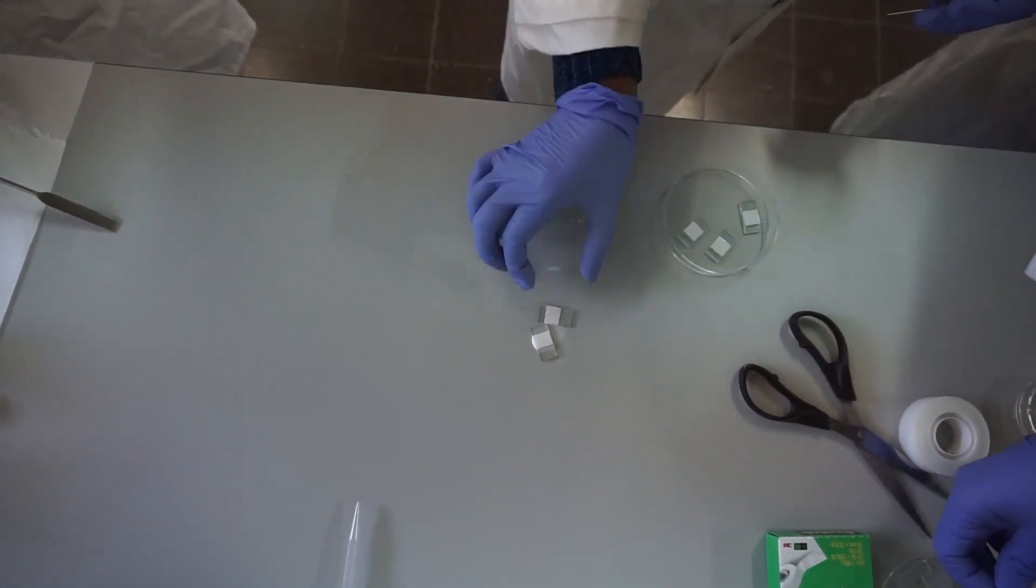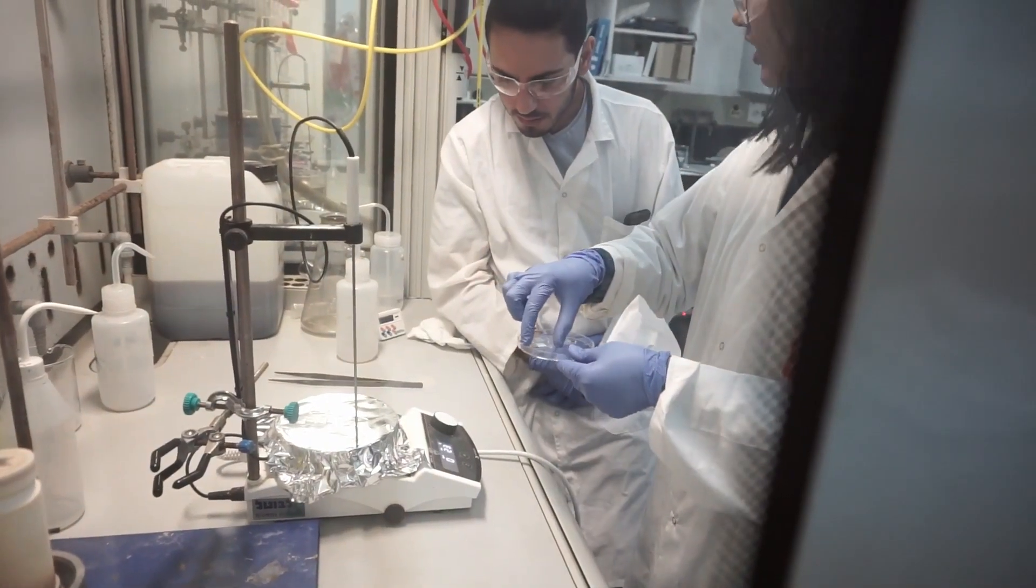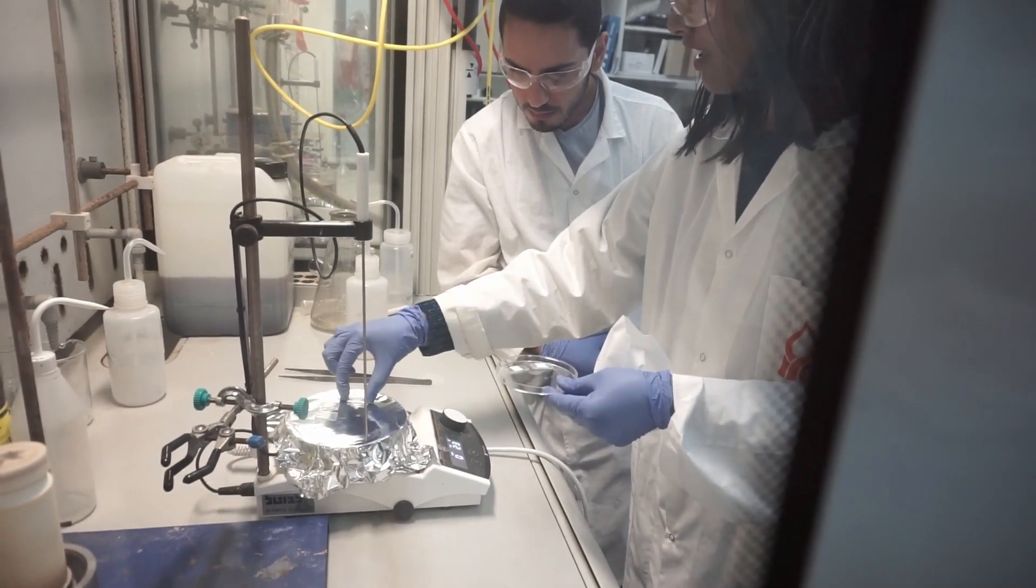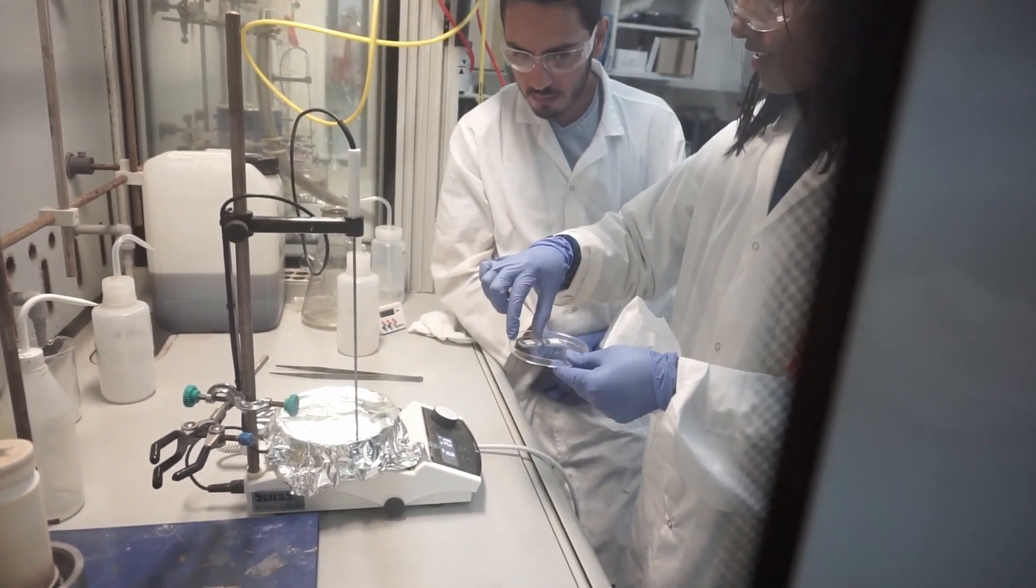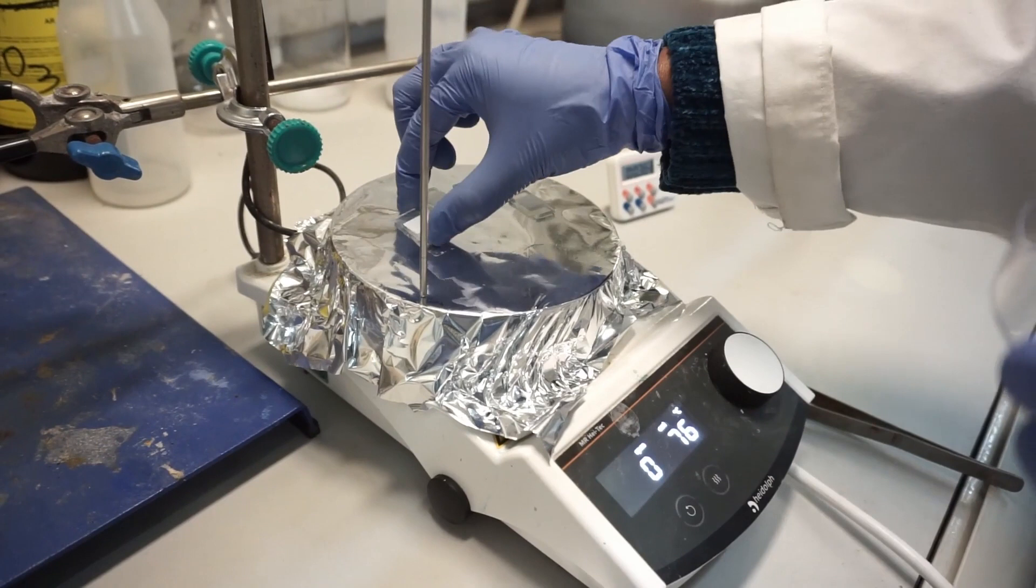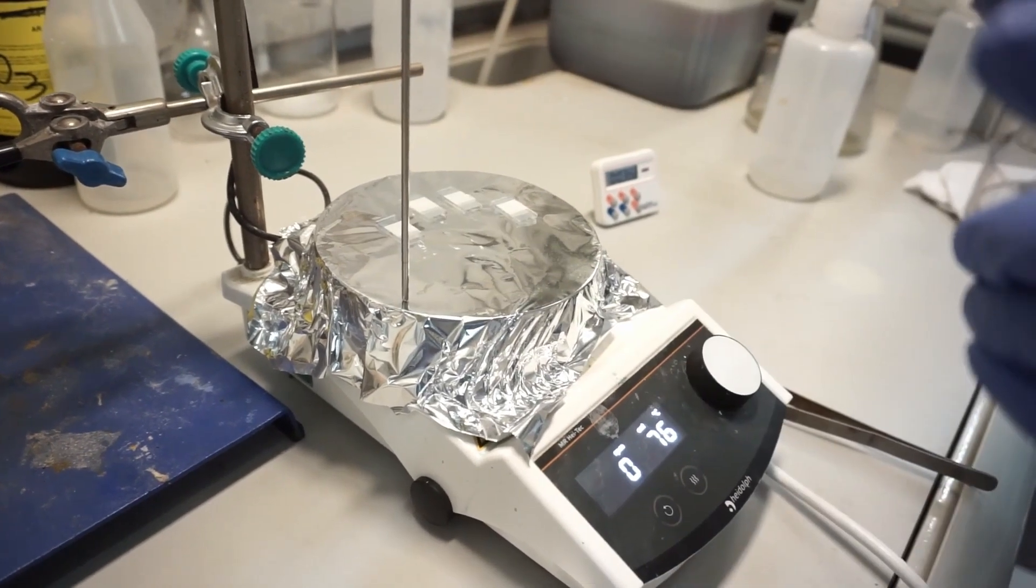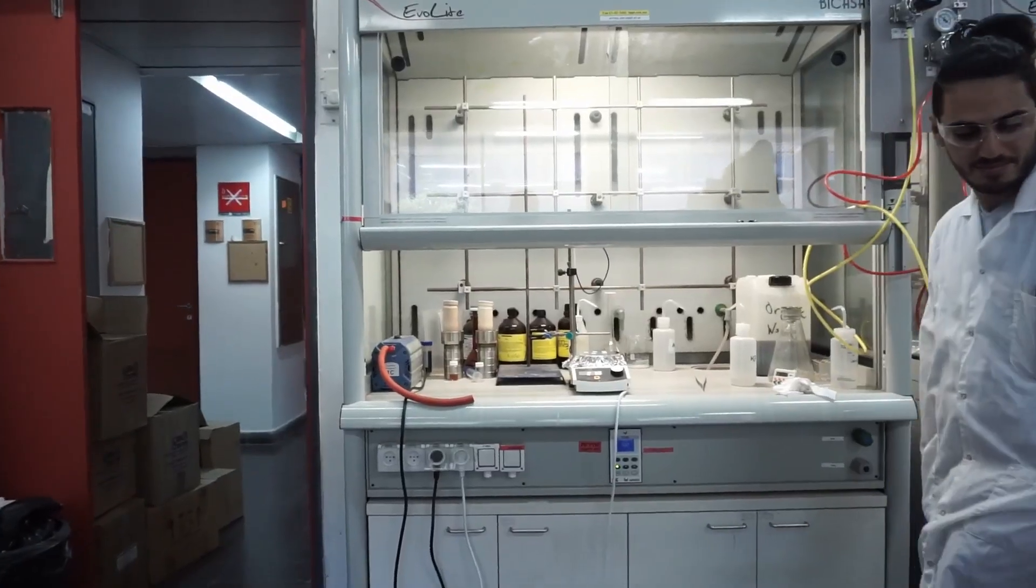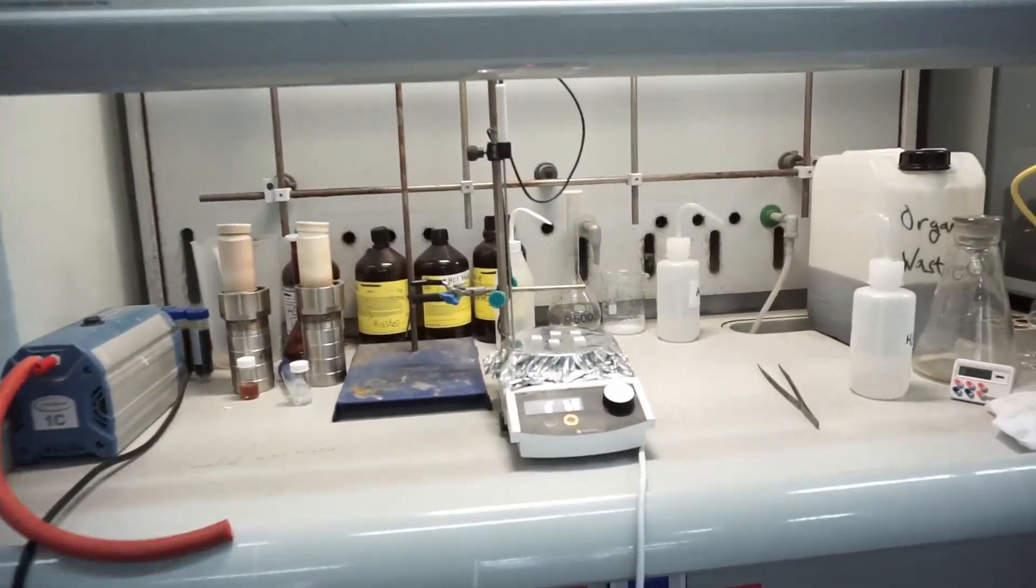We will now place the samples on a heat source to evaporate any remaining solvent from the paste. We heat our samples to 110 degrees for 10 minutes, but you should use whatever works best for your material.